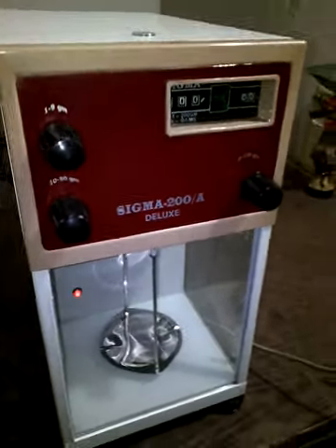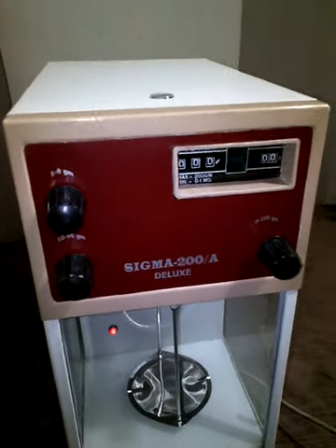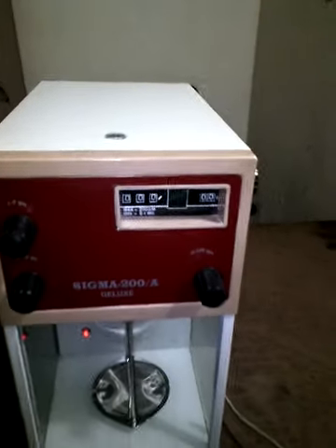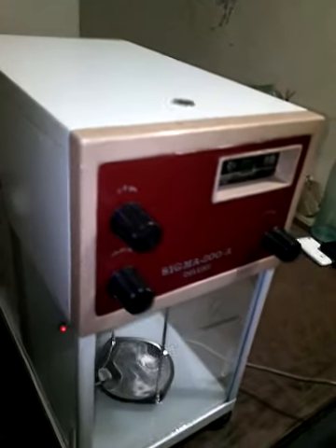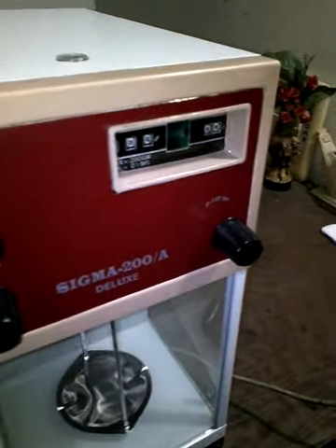After the complete assembly and adjustment of the reading, your balance is now ready for its use. This is how to install a single pan electrical balance. This completes the installation of the single pan electrical balance.